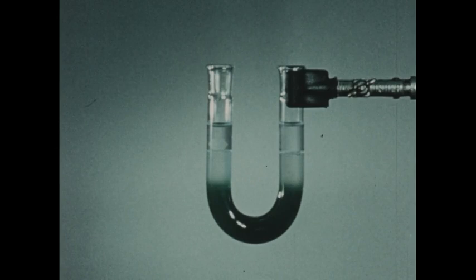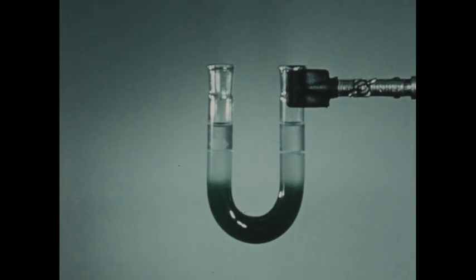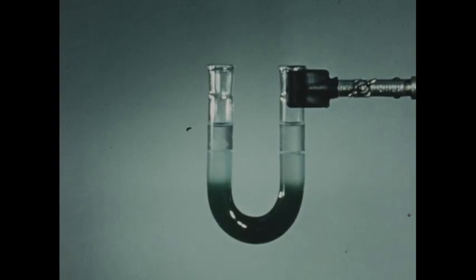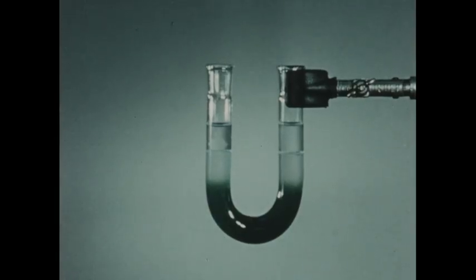When an electric current is passed through a salt solution, the ions in the solution actually migrate or travel to the respective poles, the positive ions moving toward the negative pole and the negative ions moving toward the positive pole. In the experiments that you've seen up to this time, however, all of the ions involved have been colorless, and this migration was not observed. This experiment actually demonstrates the migration of ions during electrolysis. In order to demonstrate this phenomenon, we've used colored ions.